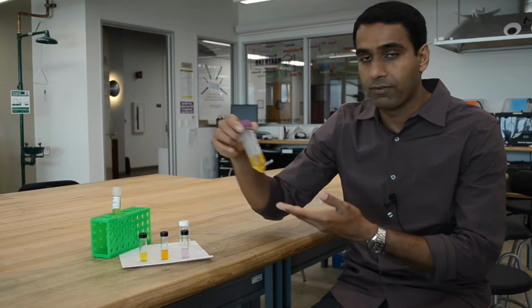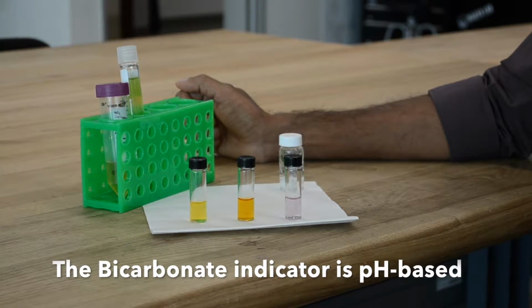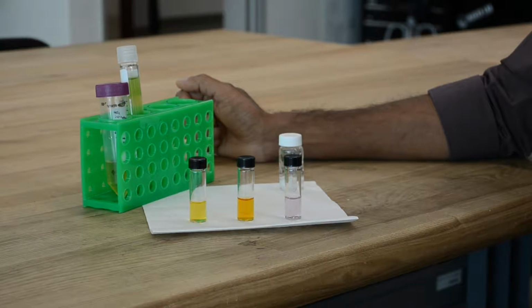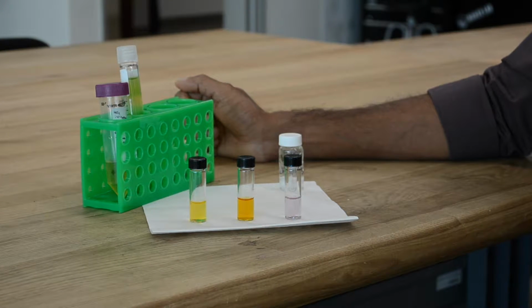For that, we have the bicarbonate indicator. The bicarbonate indicator is a pH-based indicator. CO2 in solution form is a weak acid, and as the photosynthesis reaction proceeds, more of the CO2 is being captured by the algae to lead to a change in pH.